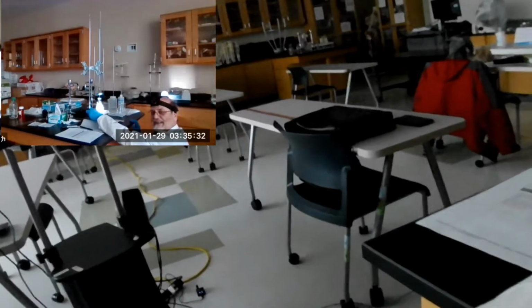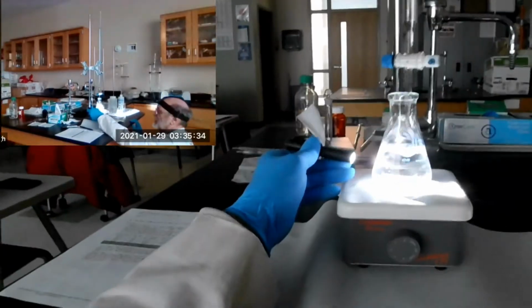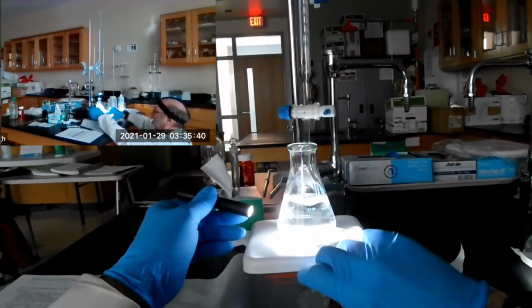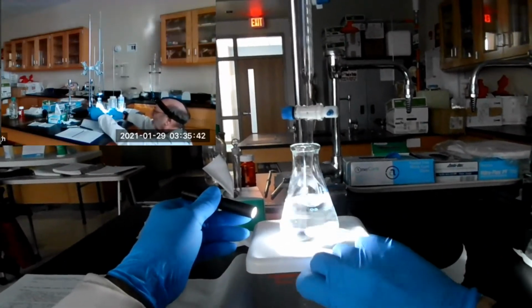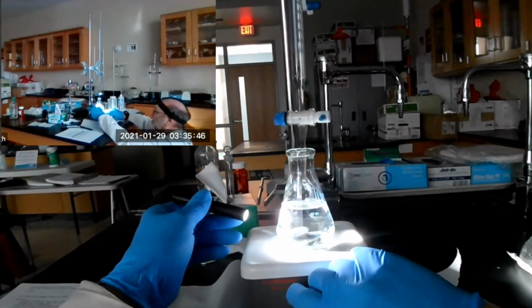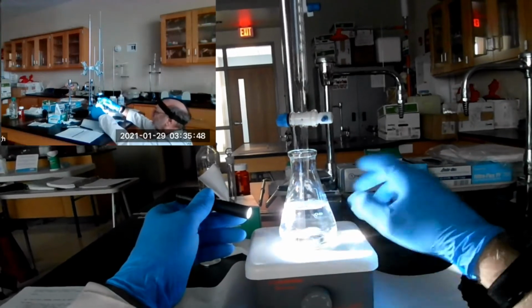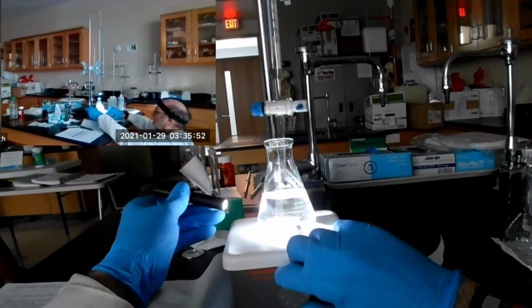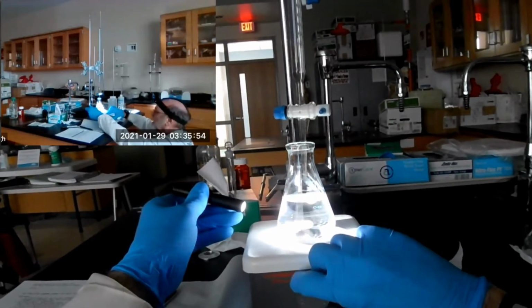That's known as magnetic decoupling, when the stir bar starts jumping around. Let's reestablish the couple and then we'll go ahead. Oh yeah, slow is plenty fast.